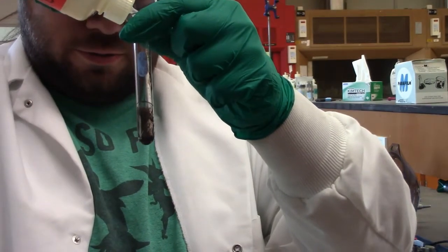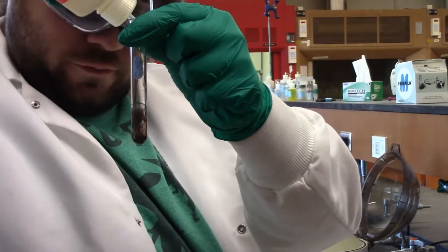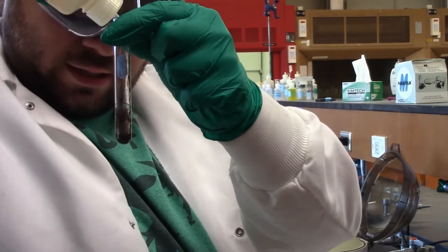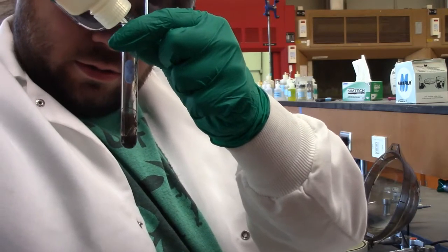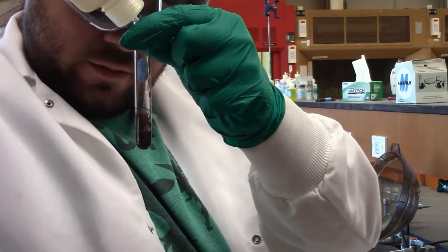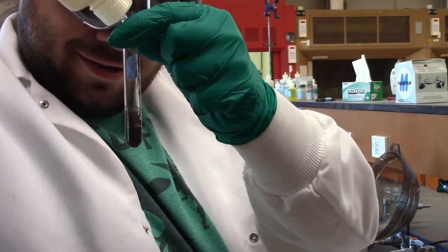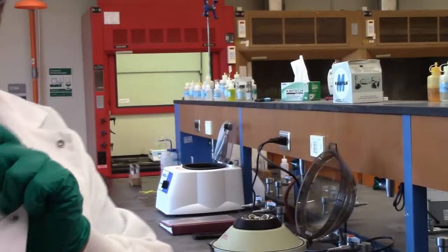Okay, hold it in front of your lab coat instead of your fly. 3, 4, 5, 6, 8. Proof that Aaron can count to 20. Sorry. To be completely honest, that might have been slightly more than 20, but yeah, we got 20.